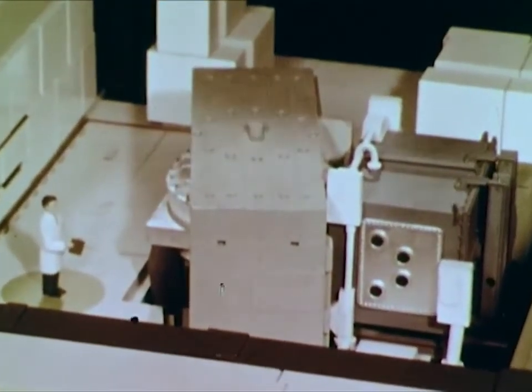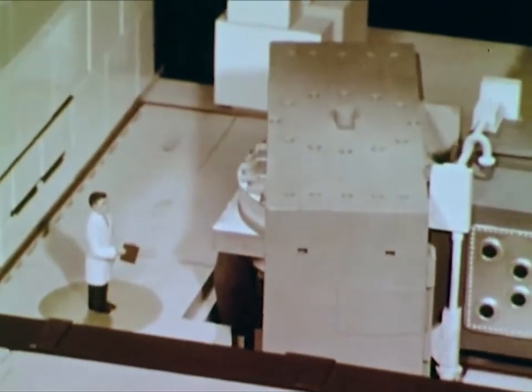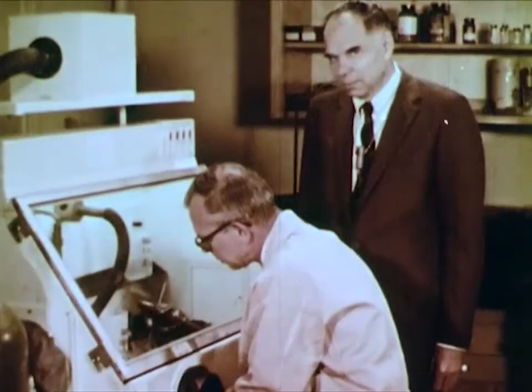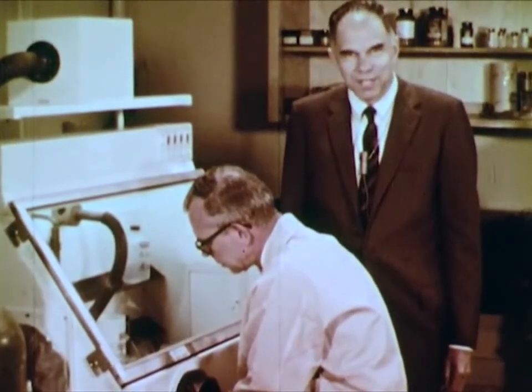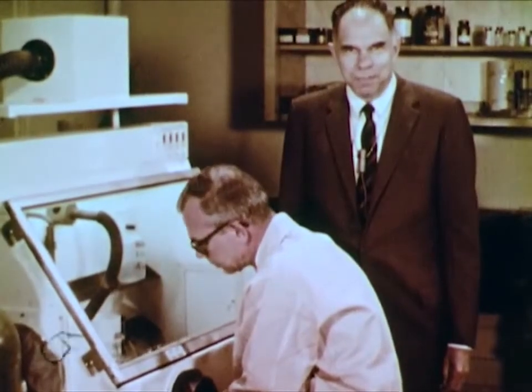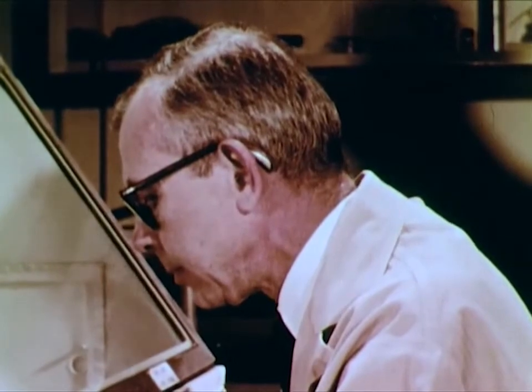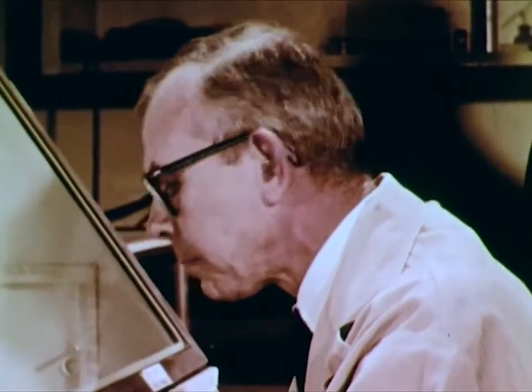Now, when these new elements were available, we could investigate their chemical properties. In order to investigate the chemical properties of these elements, we go to the laboratory of Dr. Burris Cunningham. Dr. Cunningham performed the earliest ultramicrochemical experiments on plutonium and many other transuranium elements. He was the first man in the world to actually see plutonium. We're ready to perform some experiments with the transuranium elements. These experiments will tell us something about the oxidation behavior of these elements.